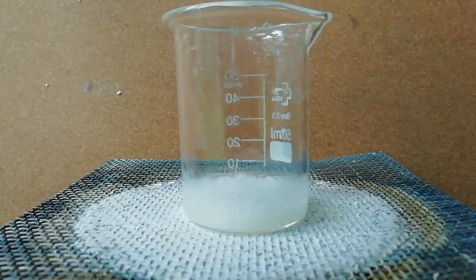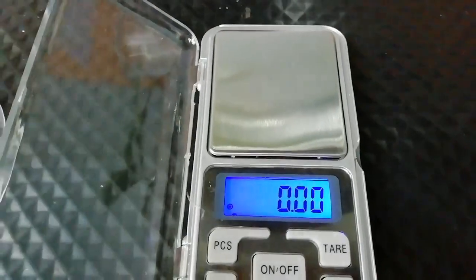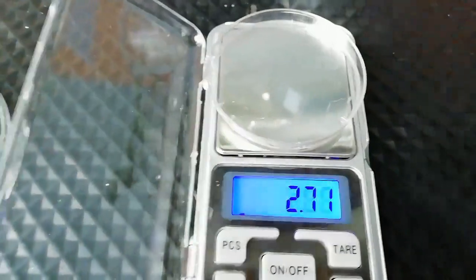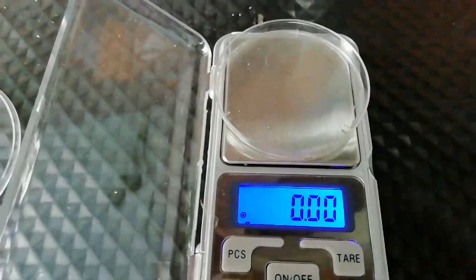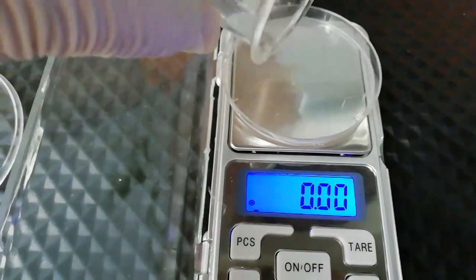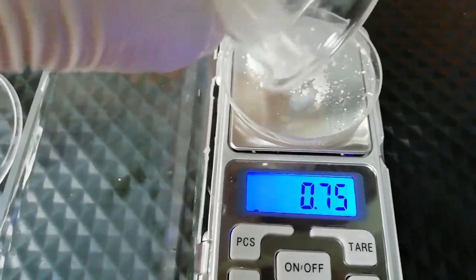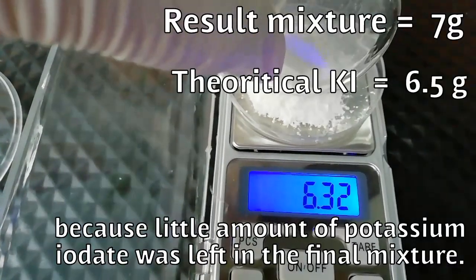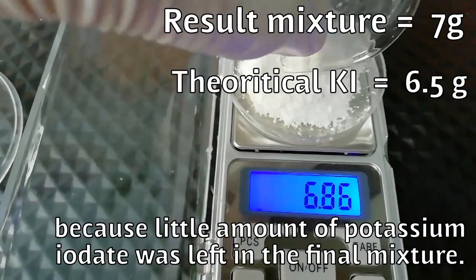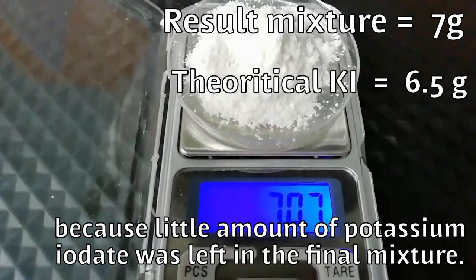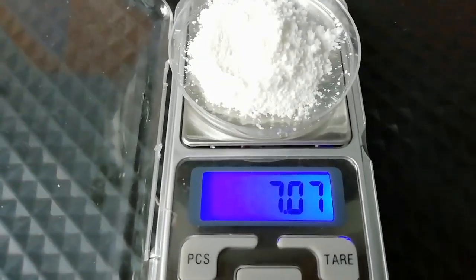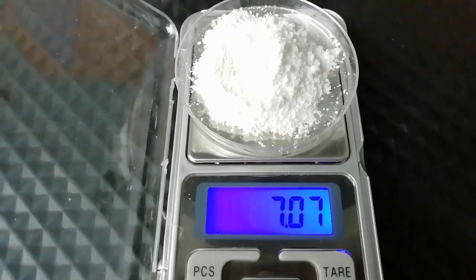Here is the final product: 7 grams of potassium iodide mixture. There is a little amount of potassium iodate as impurity. To remove potassium iodate, we can heat the solid mixture in a crucible to 550 to 650 Celsius. In this case, potassium iodate will decompose to potassium iodide and oxygen gas.